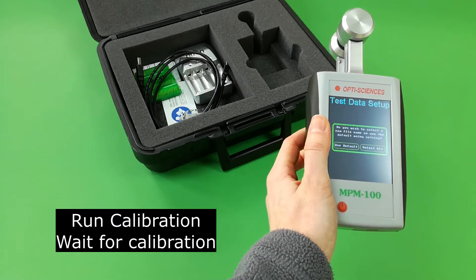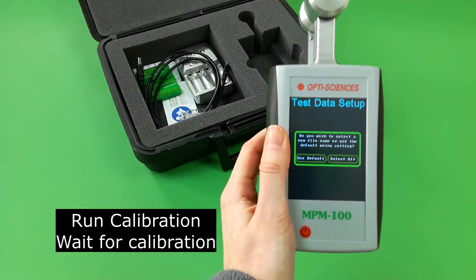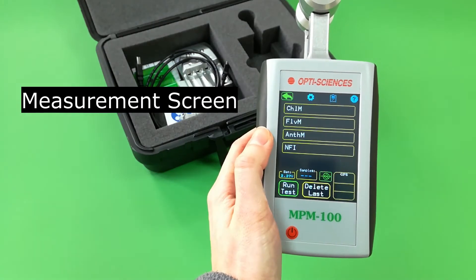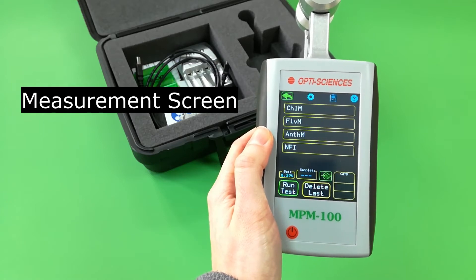Next, select a new data file name by pressing use default, or select alt to edit the name.